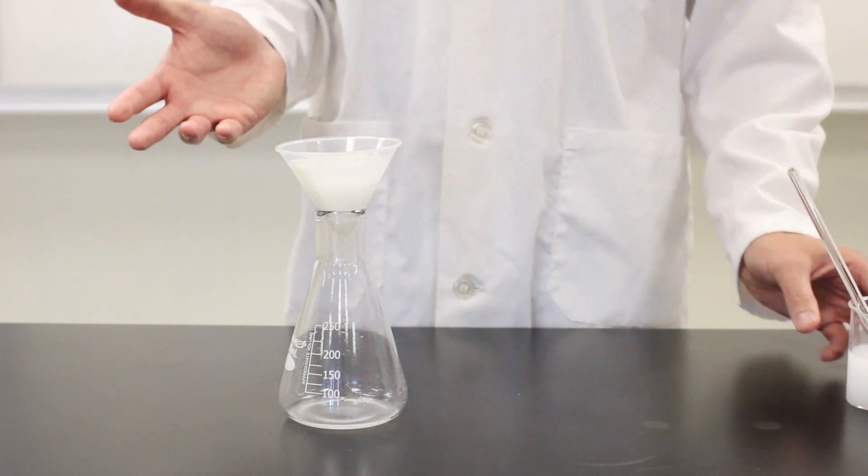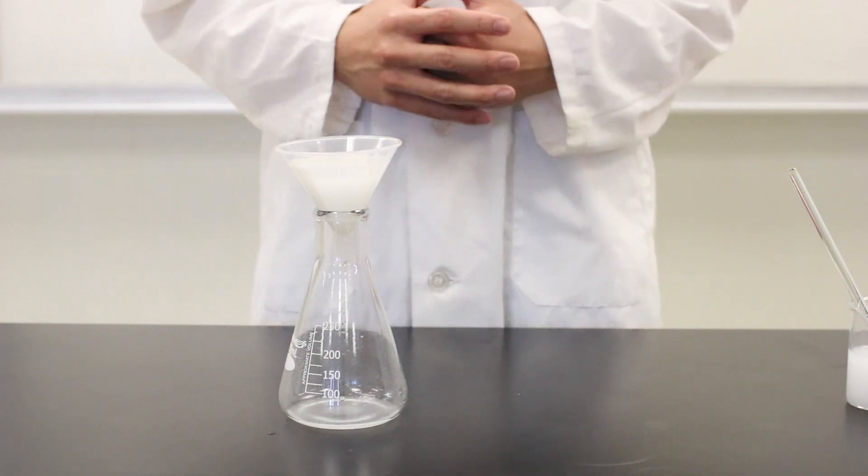So it looks like this is going to take a few rounds, so we'll wait for most of it to filter through and then we'll add some more. 11 minutes later.